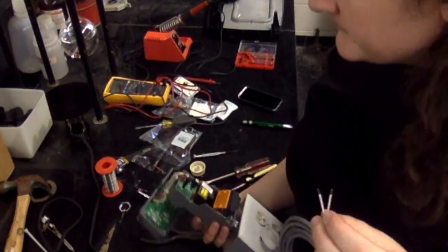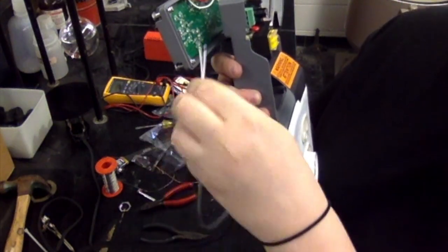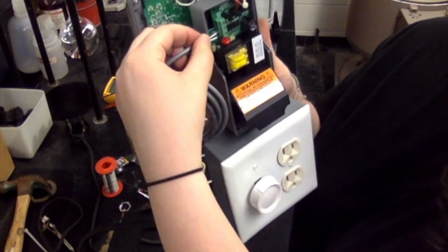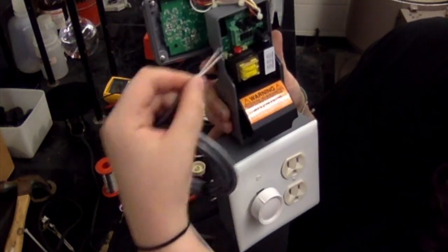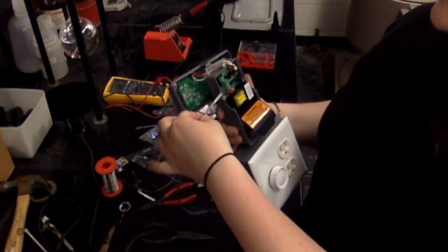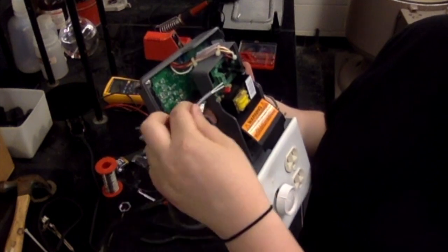And what you're going to do is, if you'll notice on the side of this unit, there's an indent for wires to go in. And what we're going to do is make the connection here and connect into 8 and 9. It doesn't matter which one goes in which port, you just want 1 in each. So you'll go ahead and do that. And another trick about this connection is you don't want a lot of strain on this. You don't want the support to be coming from the set screws in here. You want it to be pretty firm.